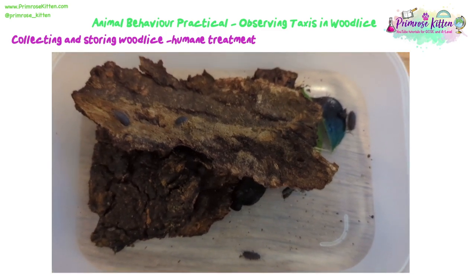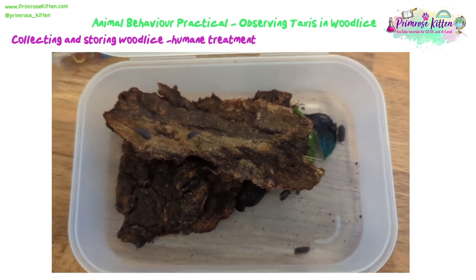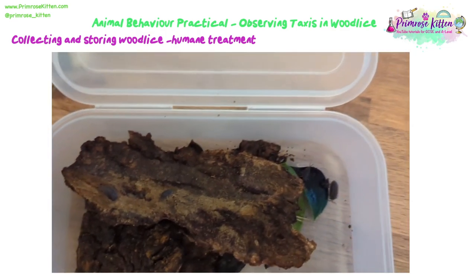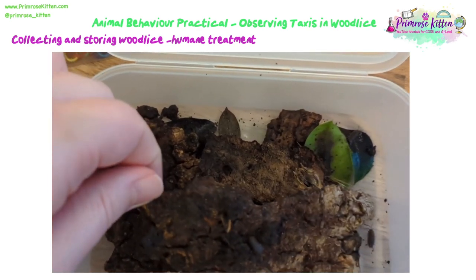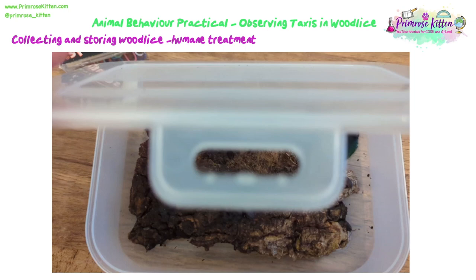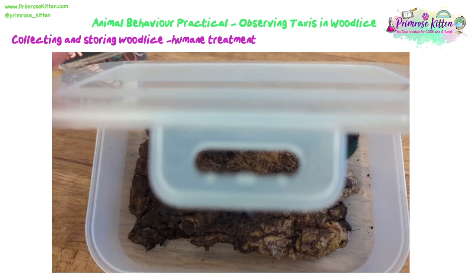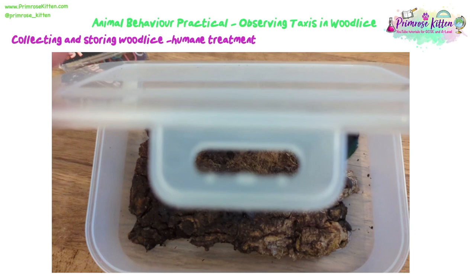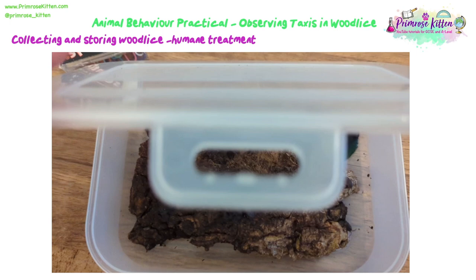I collected wood lice from outside, and it's very important to treat them humanely. I took some bark, leaves, and soil and put that into a Tupperware container so they can hide and move around in a cool, dark place when not being used. I went outside, collected the wood lice, brought them back in Tupperware, kept them in that environment, and was able to use numbers of them for each experiment, removing them from and returning them to that habitat.